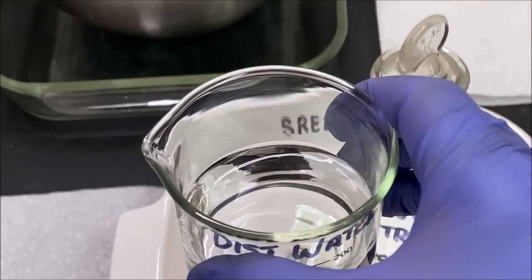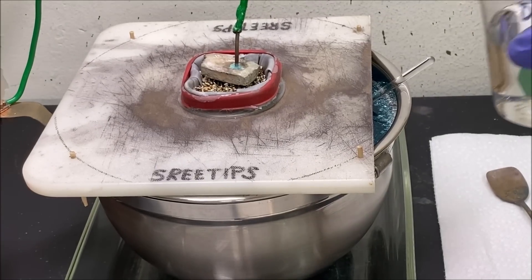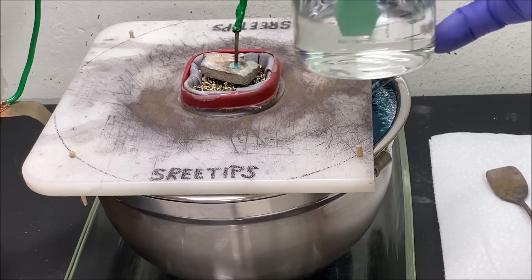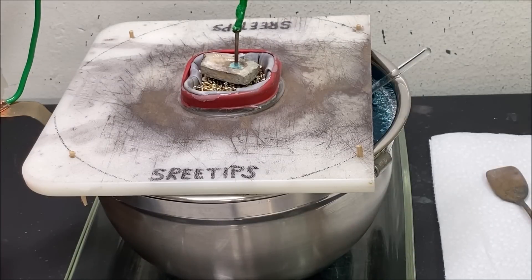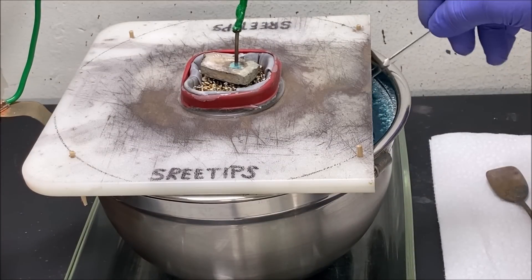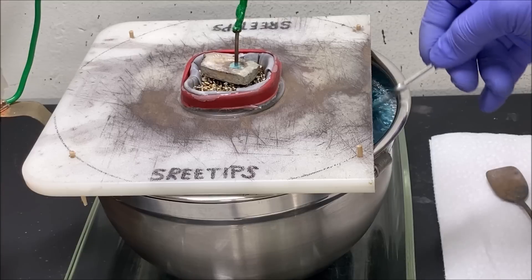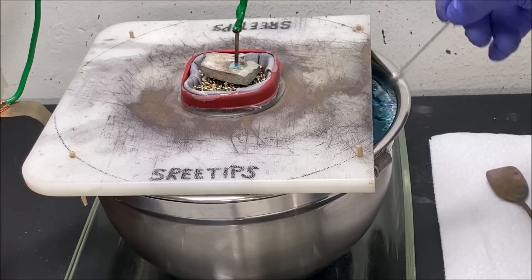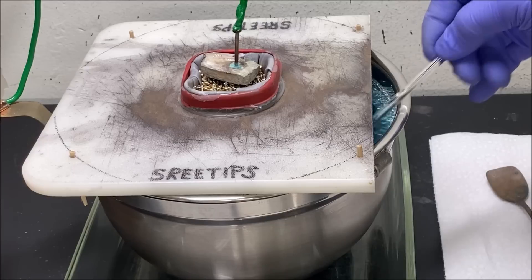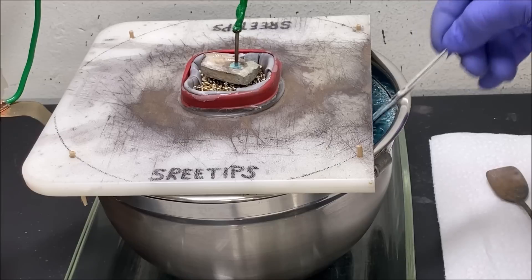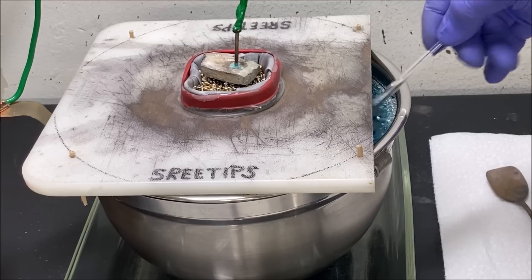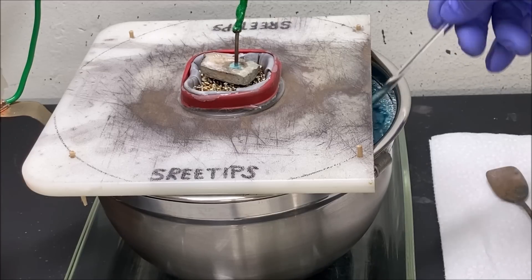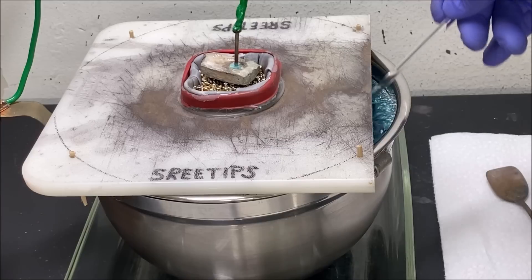Next I'll add a little bit of water. That was about 100 milliliters of distilled water. Now we'll stir this up to get a nice consistent mixture in here. The two densities of the silver nitrate and water will tend to keep them separated from each other, so by stirring it up it'll ensure a consistent mixture of silver nitrate and water.